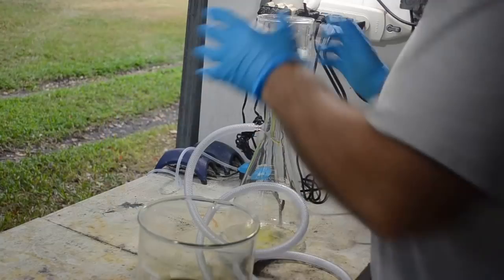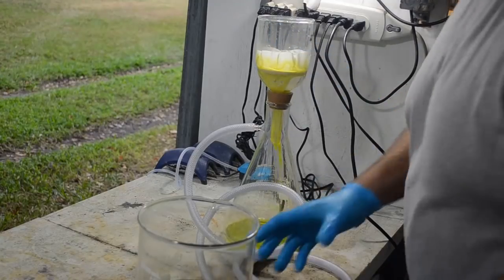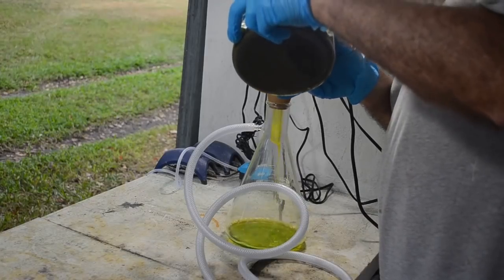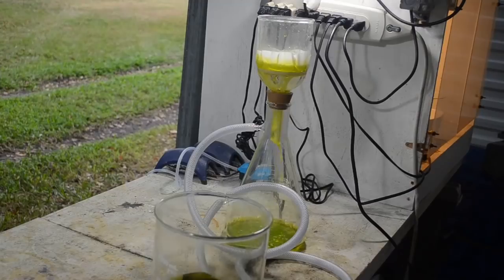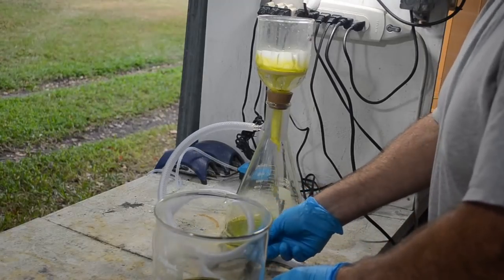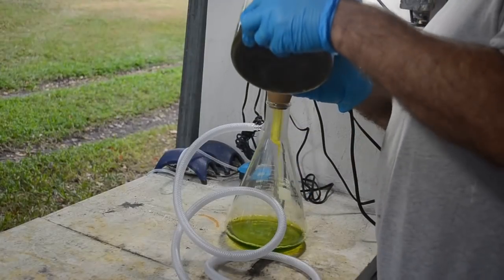Alright. The liquid's a little green, but actually on the whole it doesn't look too bad. So, you know, it's going to be a bit of a dirty gold drop out of this stuff, but I think it's actually more yellow than green. Definitely didn't get all the copper out with the nitric acid boil, but I got the vast bulk of it. I mean, you never get it all. This stuff's actually fairly yellow. It's got a definite green tinge to it, though. There's no doubt about it. It's got some copper contamination.